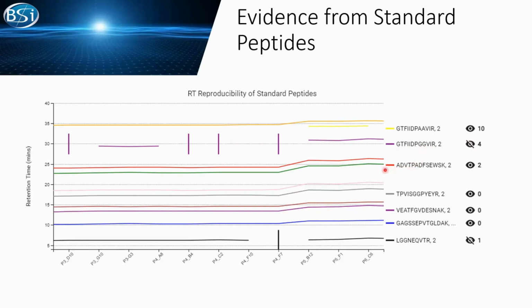From this chart, we can see, okay, we have a clear shift in the retention time of all my standard peptides starting from plate 4 up to plate 5. Now we can say, okay, combining what we know from the previous slides, we can clearly say this problem is focused on the LC part. If I'm doing the experiment, I'd start checking if there is any leaking or any column pressure increase, so I can identify my problem and solve it.